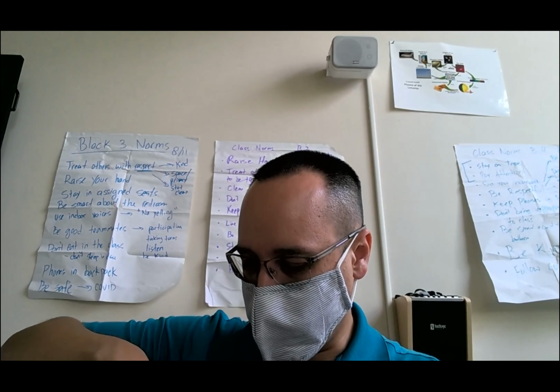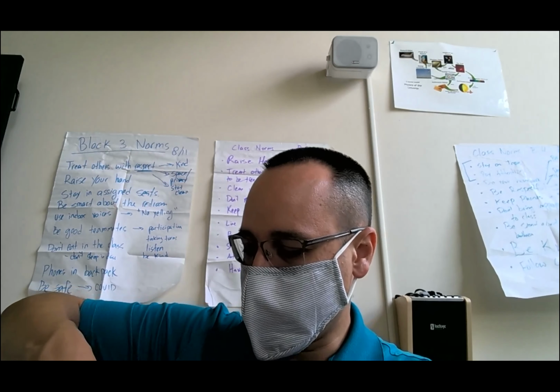Welcome back, everyone. So what we're going to do this time is continue on with our investigation of the volume and density of a marble. Okay, so I've got my marble here. Here's the marble. He was dunked in water. I had to redo a measurement, which I'll discuss shortly with you.